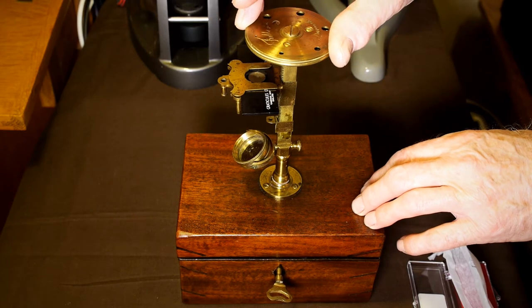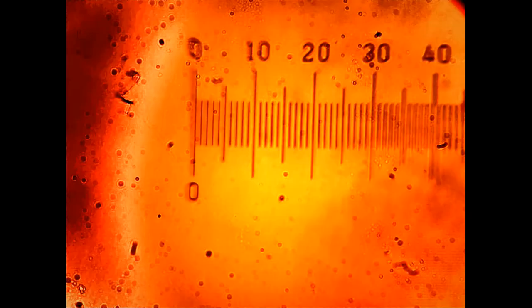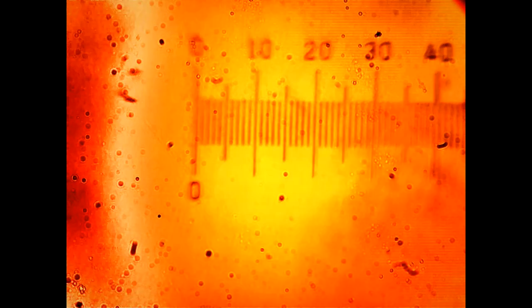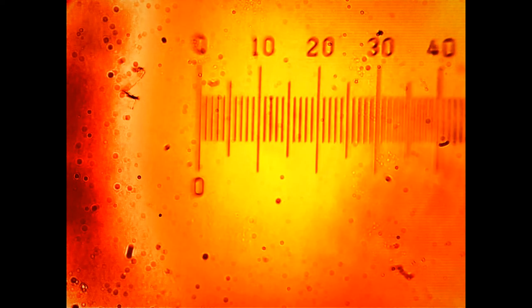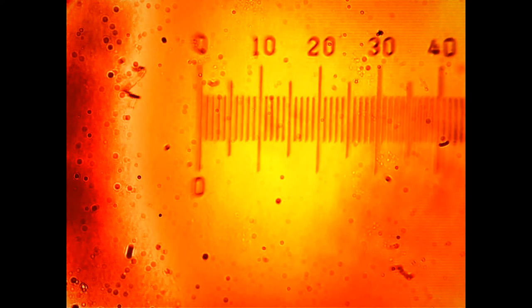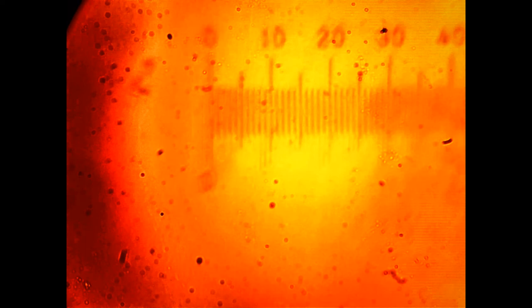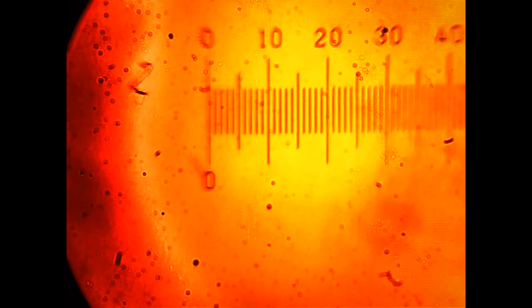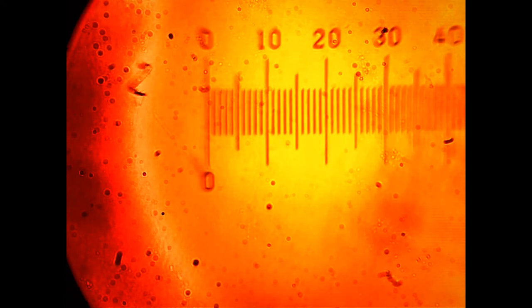Finally the x60 lens number six. We can see how the image drifts around as the stage plate is racked up and down to achieve focus. Nothing's really fixed and solid with these instruments. There's a continual interaction between user and microscope.